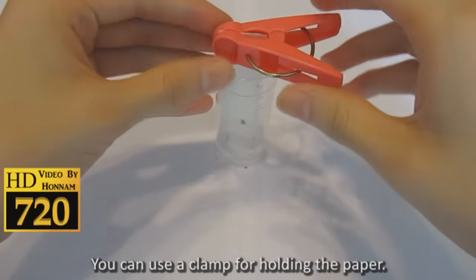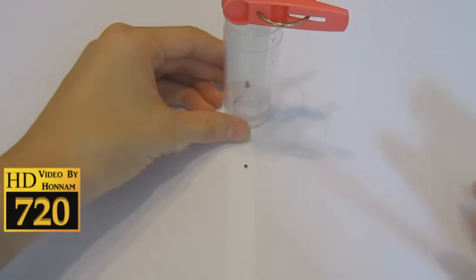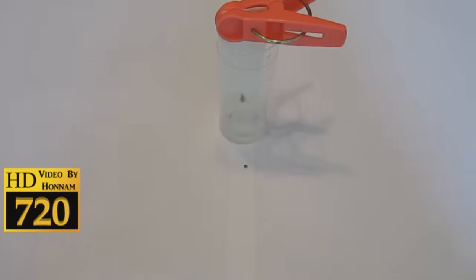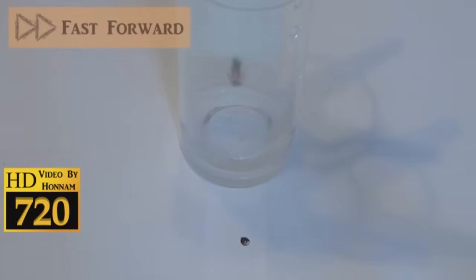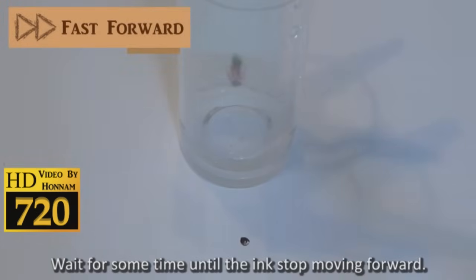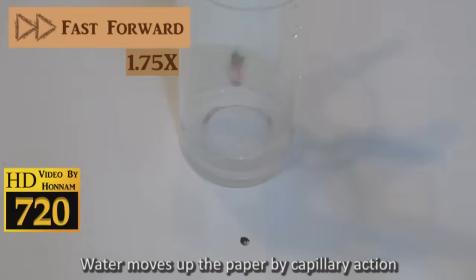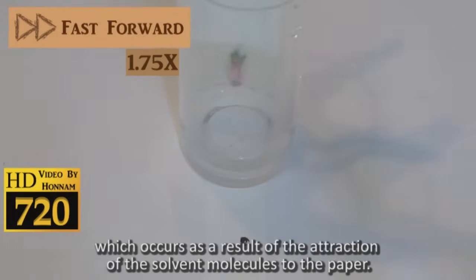Wait for some time until the ink stops moving forward. Water moves up the paper by capillary action, which occurs as a result of the attraction of the solvent molecules to the paper.